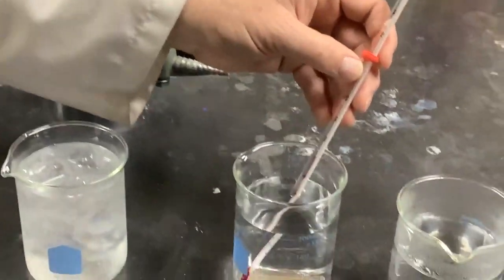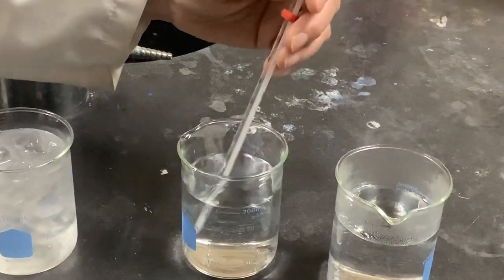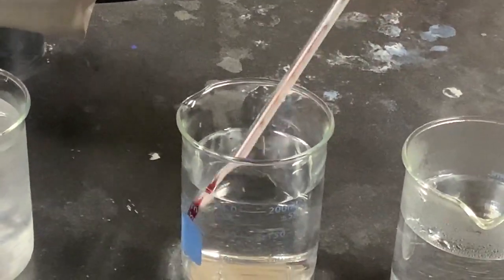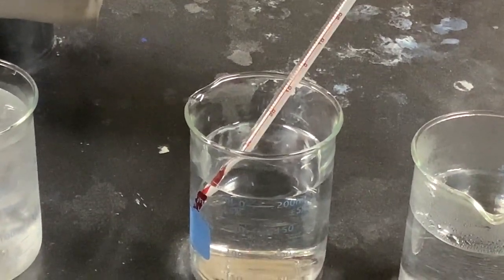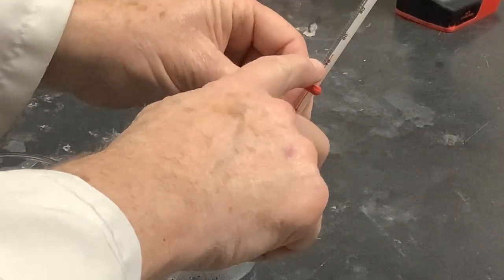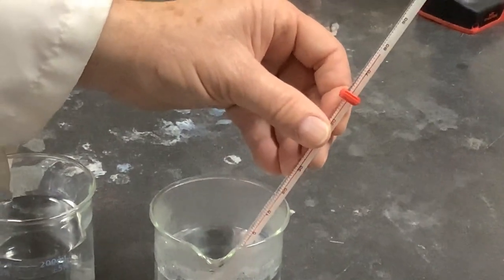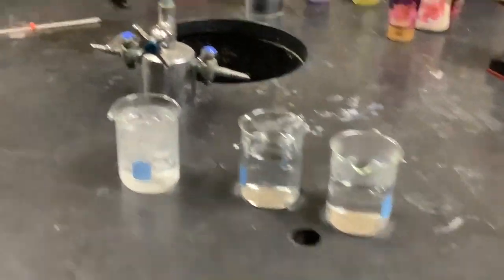The room temperature beaker, we're at cool room temperature here in our classroom lab, is rising up to cool room temperature. I like the room a little cool, so the thermostat is set down. It is going to 20 and a fraction, almost 21. So we'll call this 21 degrees, cool room temperature. And the boiling water is going to send that liquid up high, all the way up here to 78 degrees. So we had 2, 21, and 78 degrees.